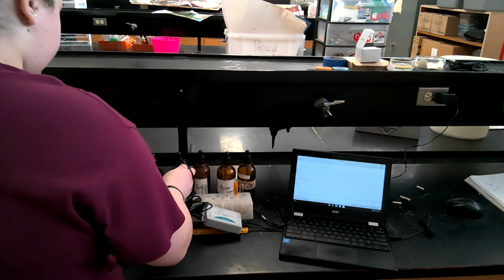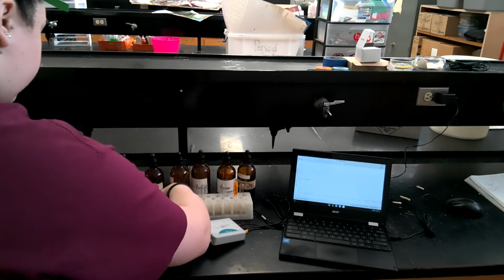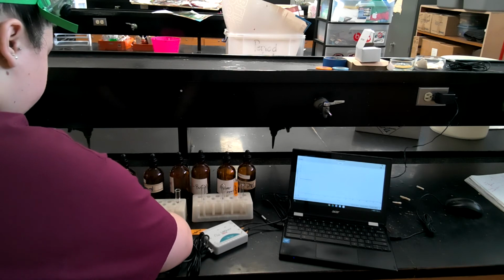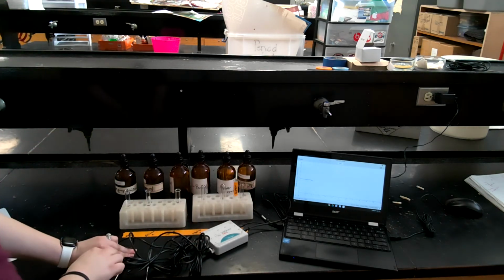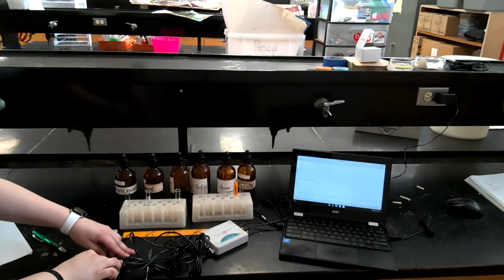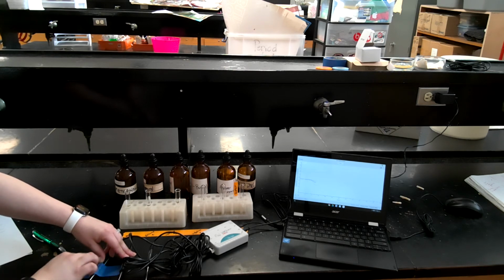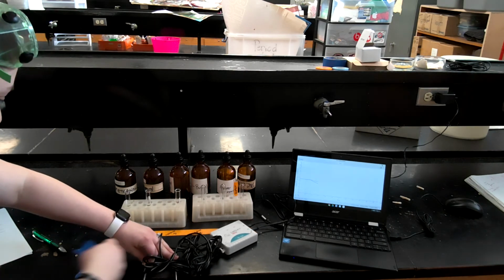Okay, so now that those have been in there for about a good minute, I am now removing them at the same time from the test tube. It is important that you remove these simultaneously, so that you can immediately start to see that drop on your Chromebook screen. You might be able to see it, you might not, but as soon as I removed all 3 of my probes, I saw an immediate drop in my lines.